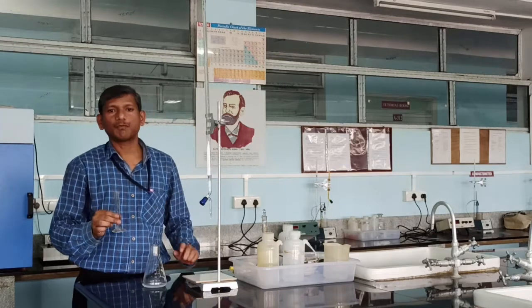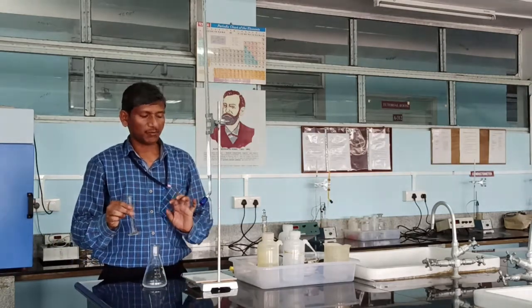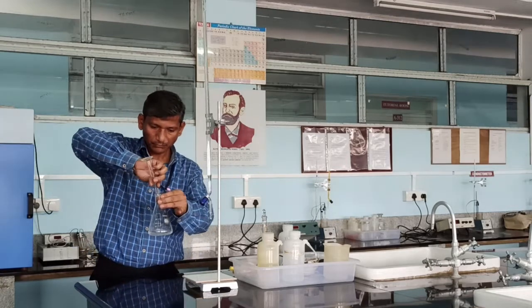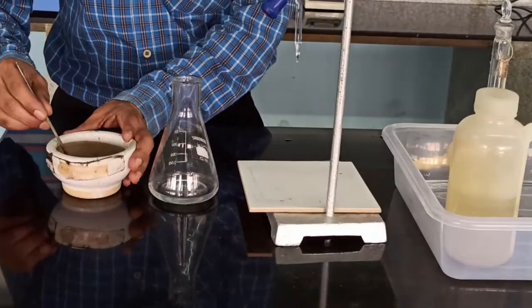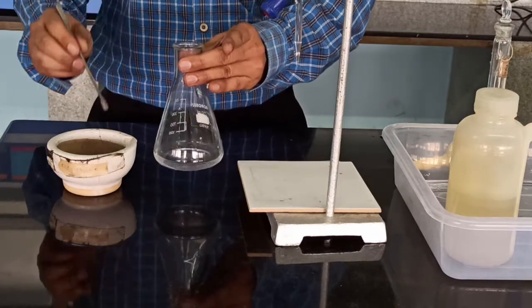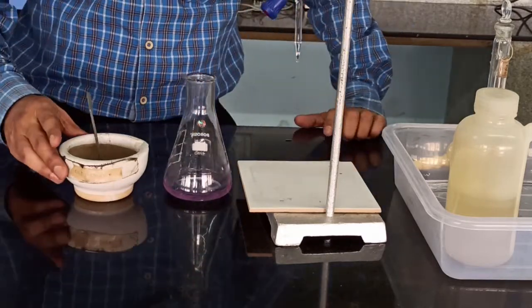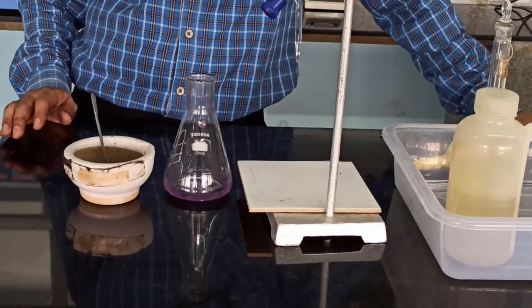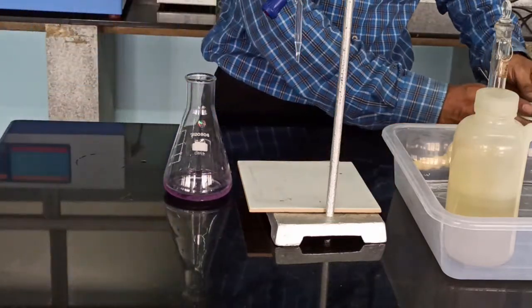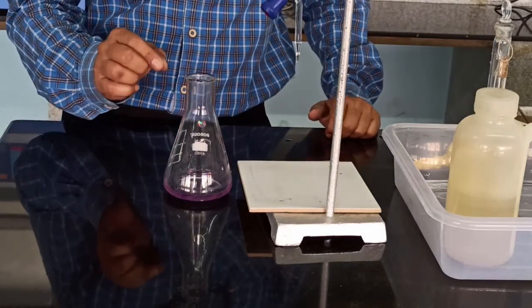The purpose of adding the buffer solution is to maintain a constant pH of 10. A buffer solution has the capacity to resist a change in pH. One more function of this buffer solution is that it favors complex formation. Then add a pinch of Eriochrome Black T (EBT) indicator. This indicator is added to indicate the end point of the reaction. EBT is also called a metal ion indicator since it reacts with metal ions and forms a complex. This color is due to the formation of a complex between EBT and the calcium and magnesium ions present in the water sample.